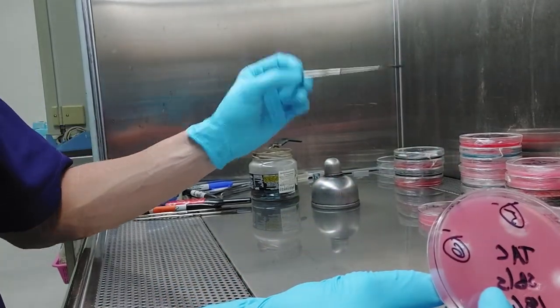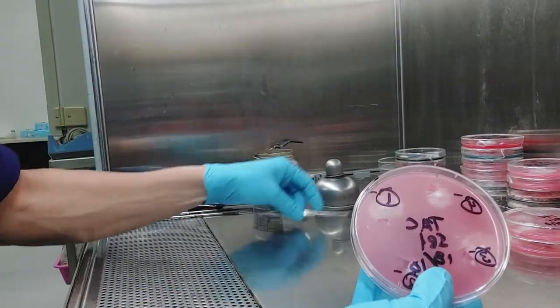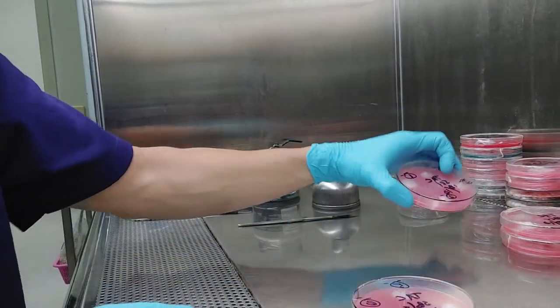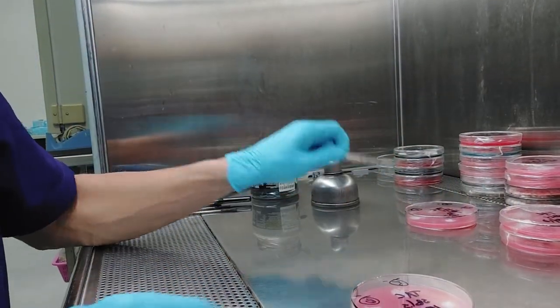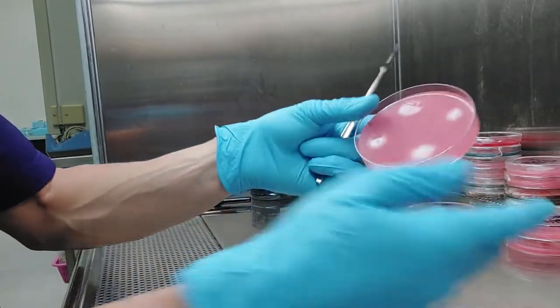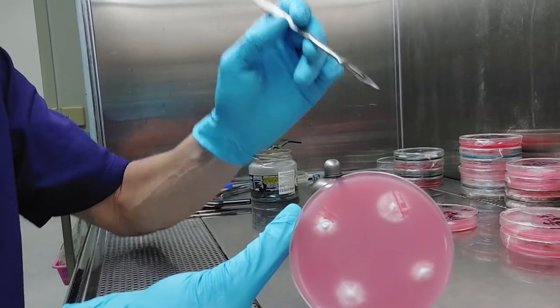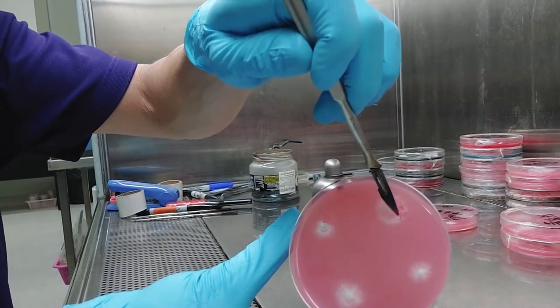So let's say I put five, six. I already checked those. Notice there's a minus sign there too. That means minus, no clamps. So notice one, two, three, four. There's a minus for each. So every time I check them under the scope, I do two things. I write a minus there, and I subculture. So if you look here, there's two little slices or multiple slices. I've made basically one, two, three, four little squares.